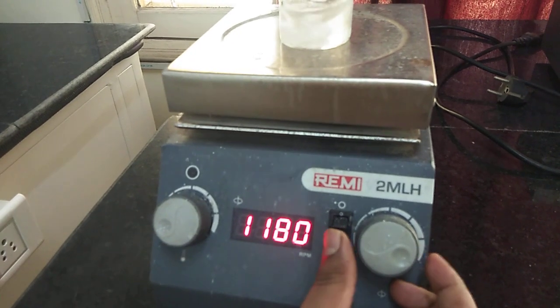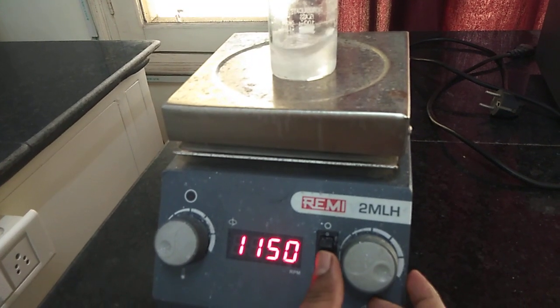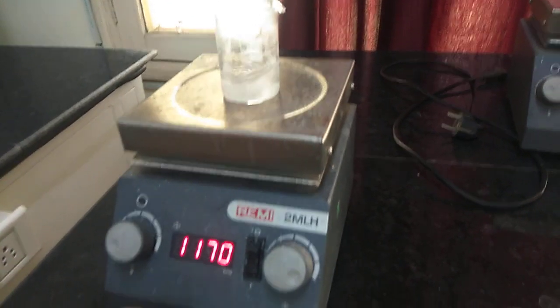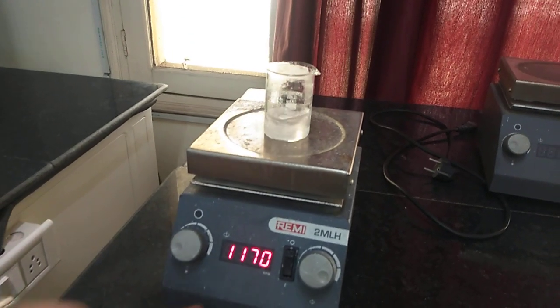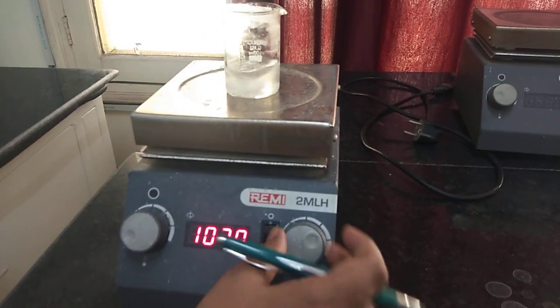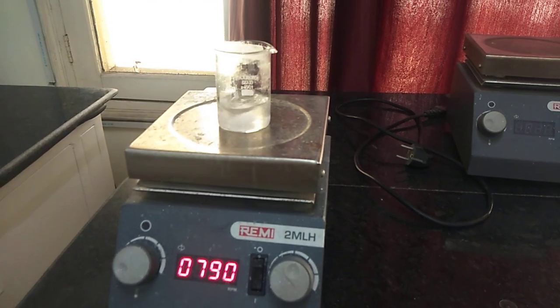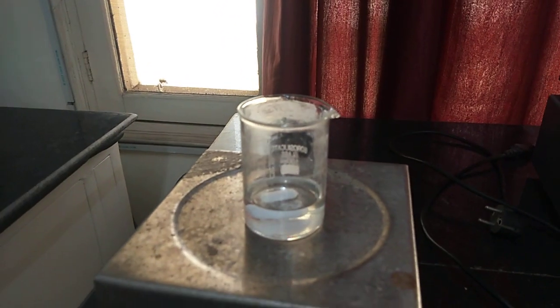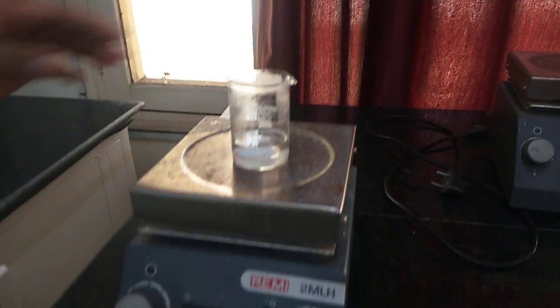The RPM can be taken up to 1200 — you can see the display showing 1130 to 1140, stabilizing near 1200. By increasing or decreasing the RPM knob, the solution rotates faster or slower. You can see the resulting transparent and clear zinc acetate solution that has been prepared.